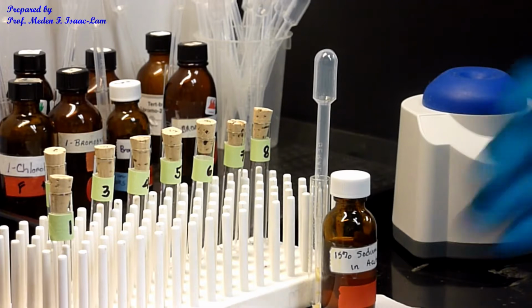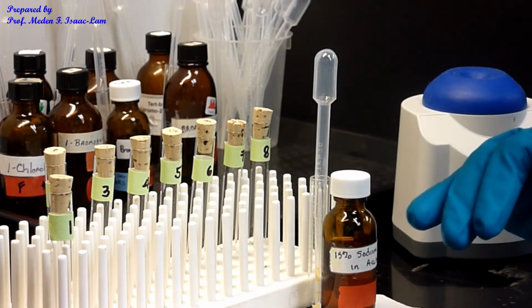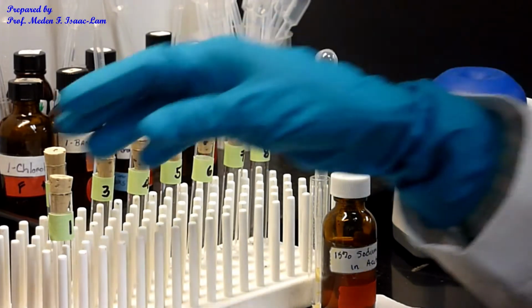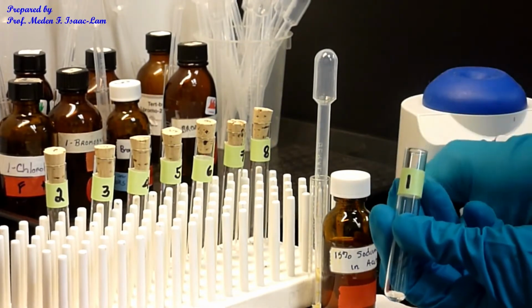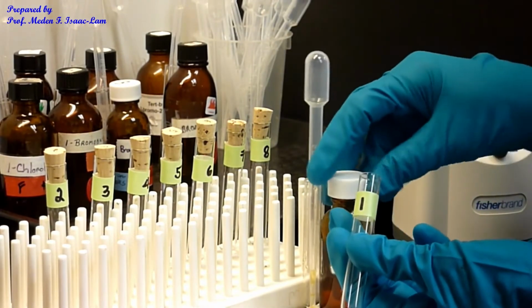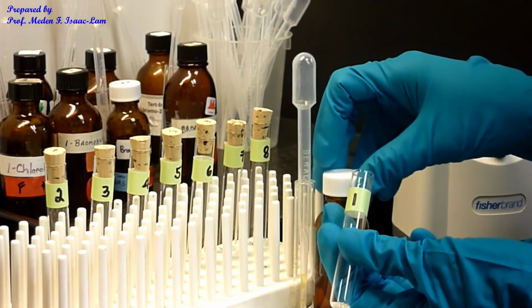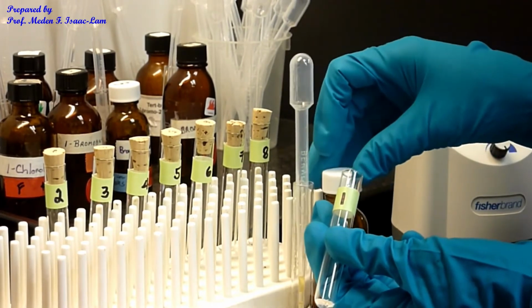And that's the time. And then we will also observe the amount of precipitate after 5 minutes for the sample. Okay, so sample 1, I add a drop. And there's always going to be some instantaneous cloudiness, but after you add more, or if I shake it, it will disappear.